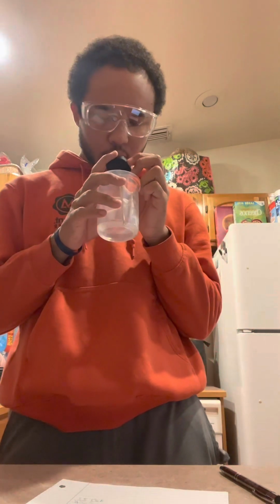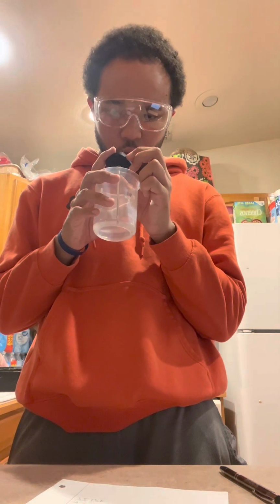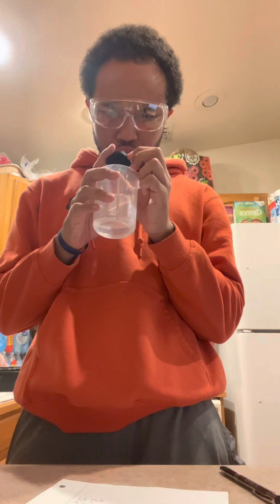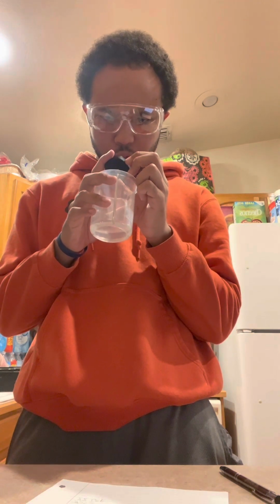That goes 16, 17, 18, 19, 20. 22, 23, 26, 27. So it's looking about 20. Wait. 2, 3, 4, 5, 6.